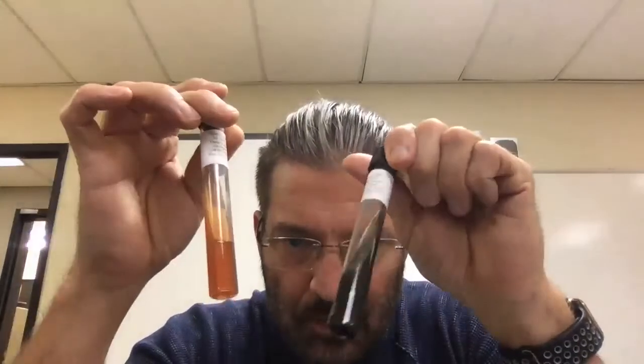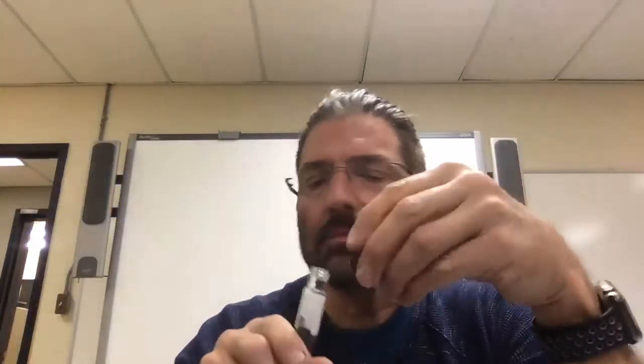There's Proteus, hydrogen sulfide. And the baseline. I'm going to end this one and upload this one too.